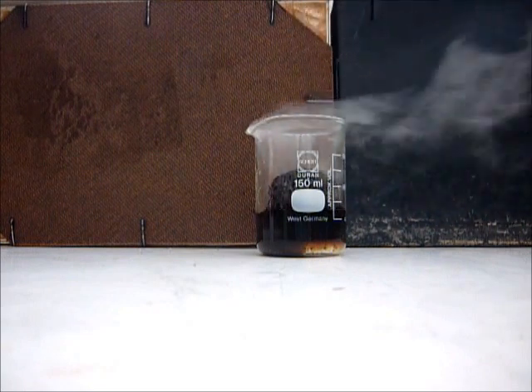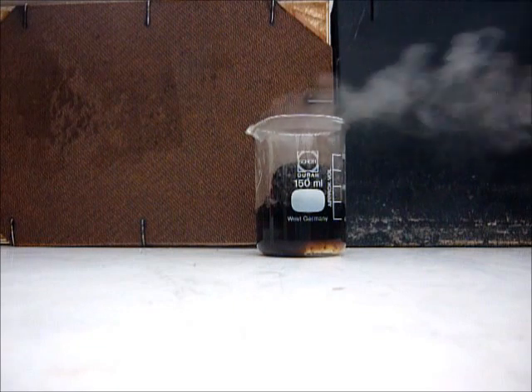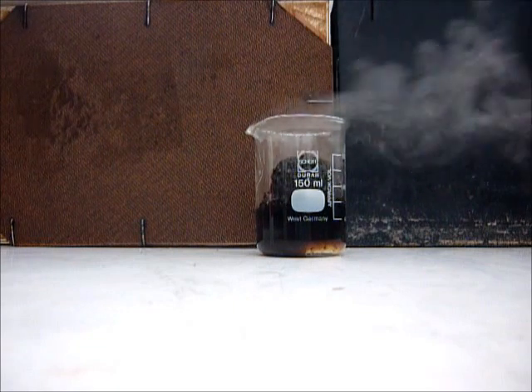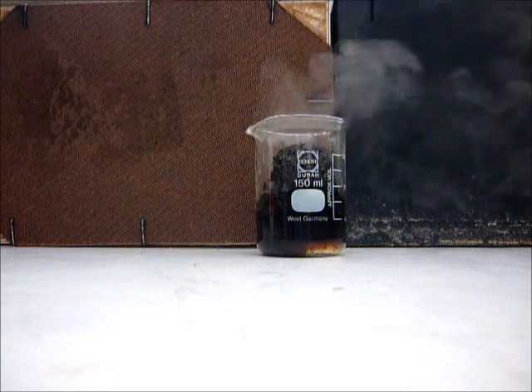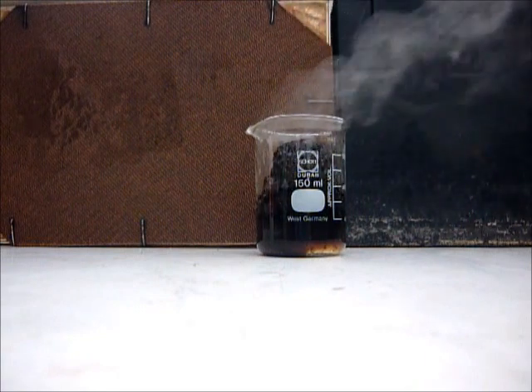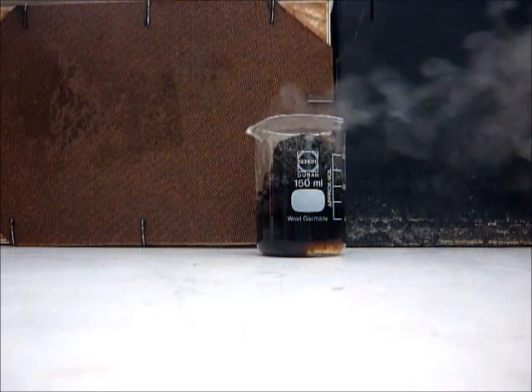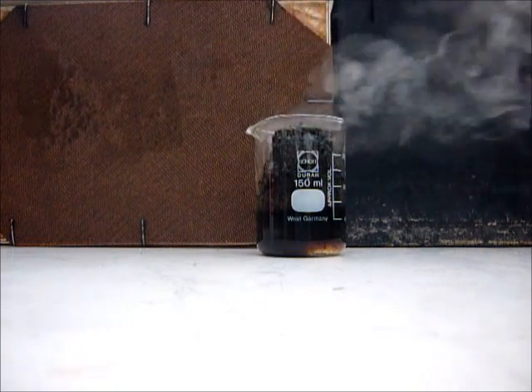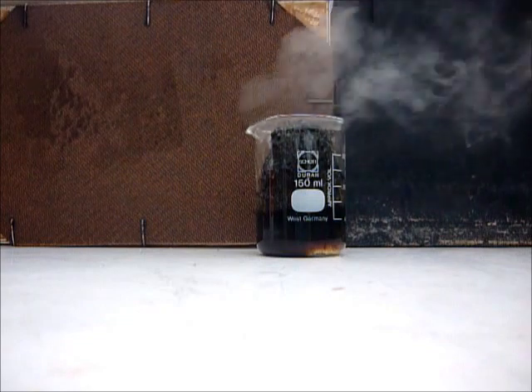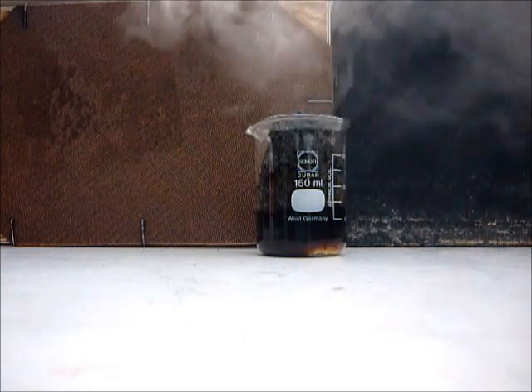The fume contains water vapor and sulfur dioxide, and it smells a little bit like toffees from the sugar which is burnt. It's growing faster and faster, and hopefully it will, yes, it gets out of the beaker.